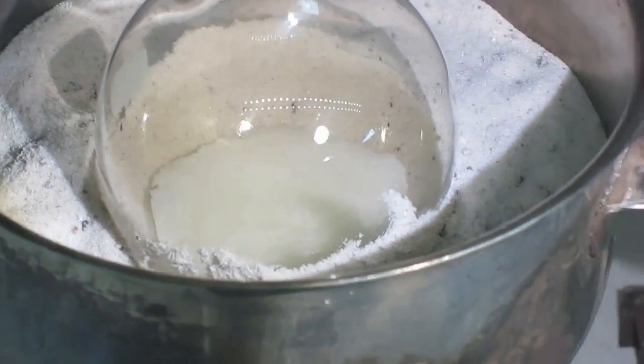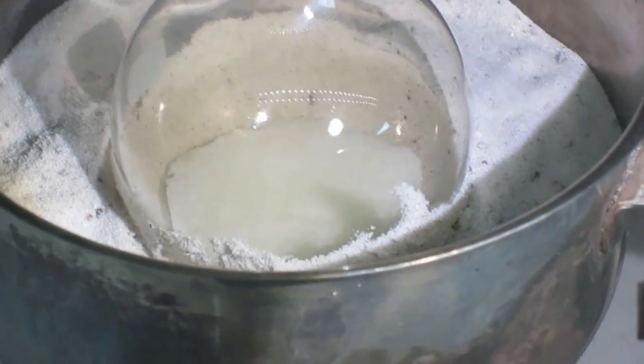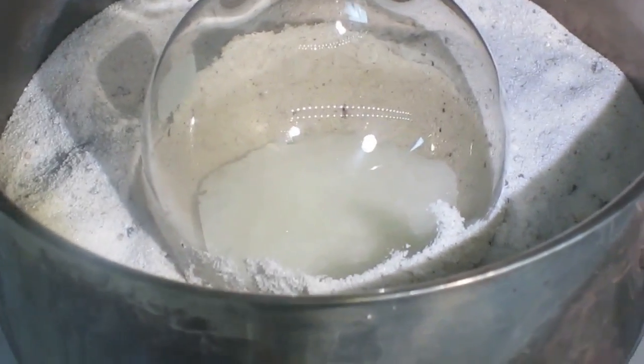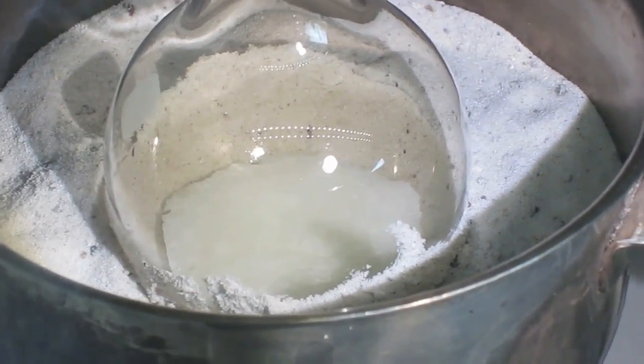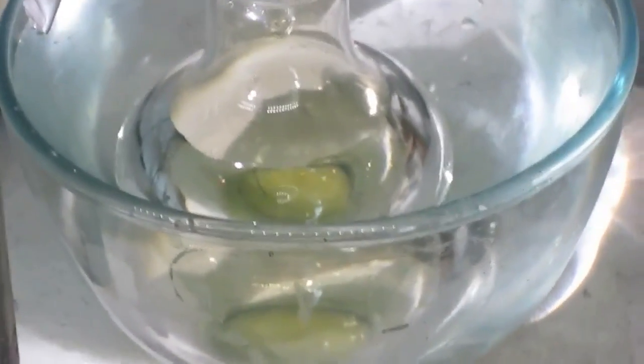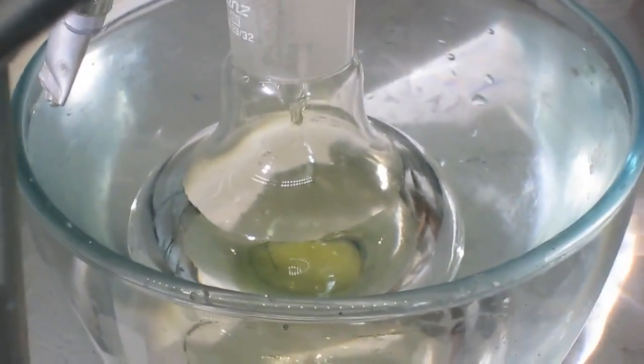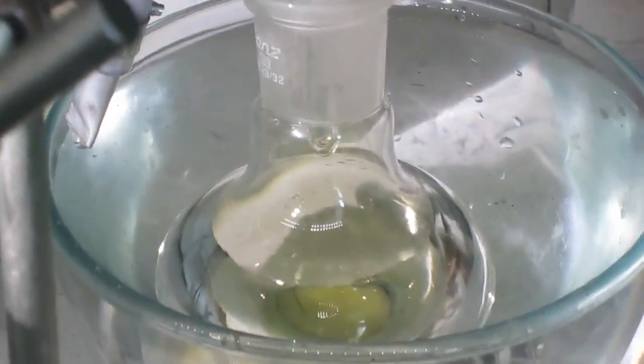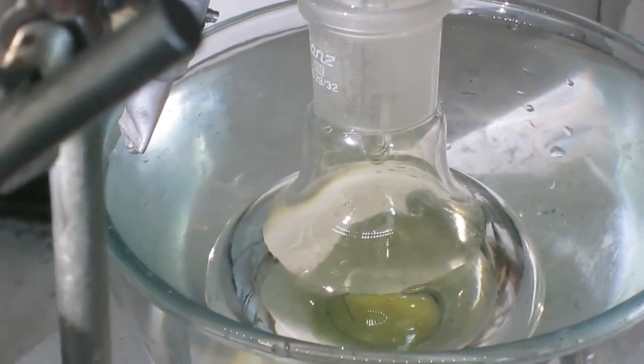Okay, the distillation is now finished. You see crystals of KHSO4 in the flask. And on the other side, the Florence flask. There's a little bit acid still dropping. When it stops dropping I will finish it.